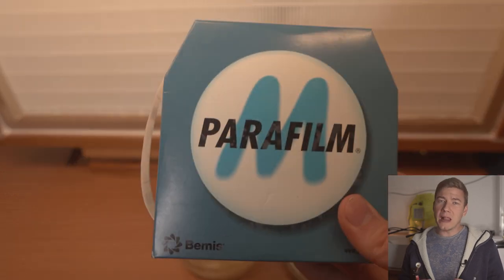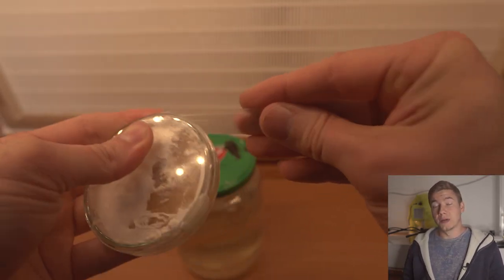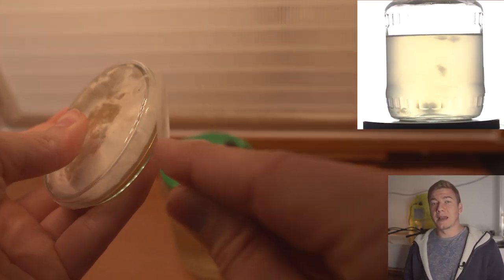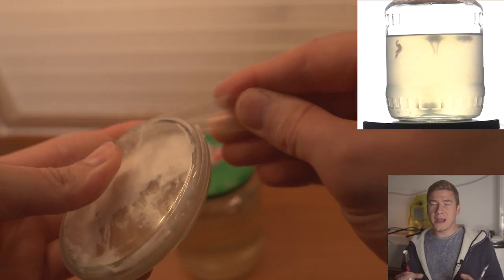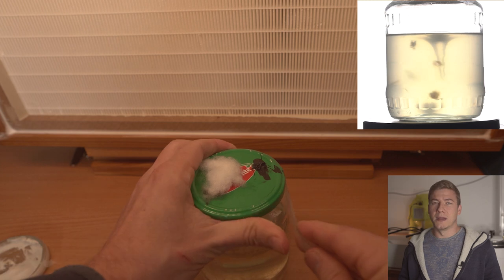Then we just have to seal everything. I use some parafilm and then we're ready to go. Now we just have to mix the solution a couple times, like every one or two days, to break up the mycelium so that after maybe one week, those nice mycelium clouds will appear.